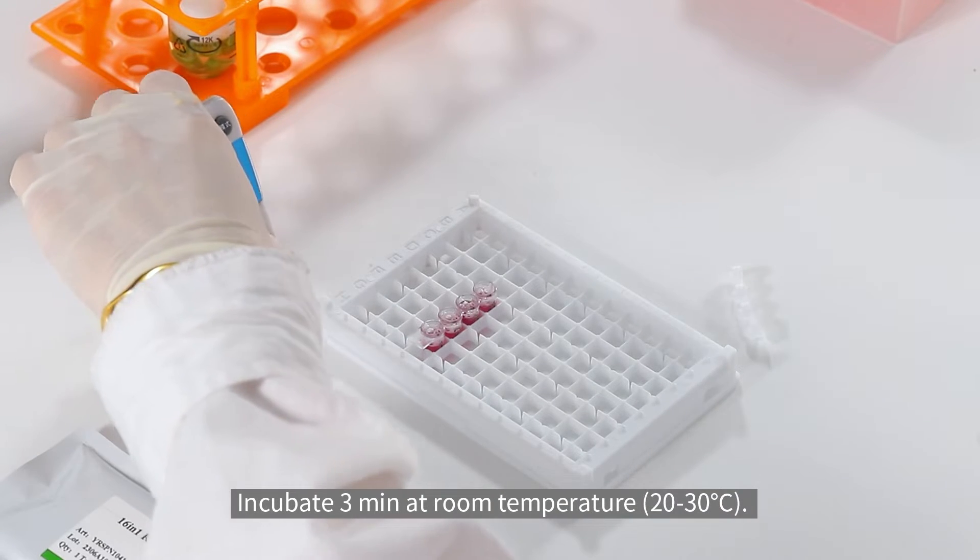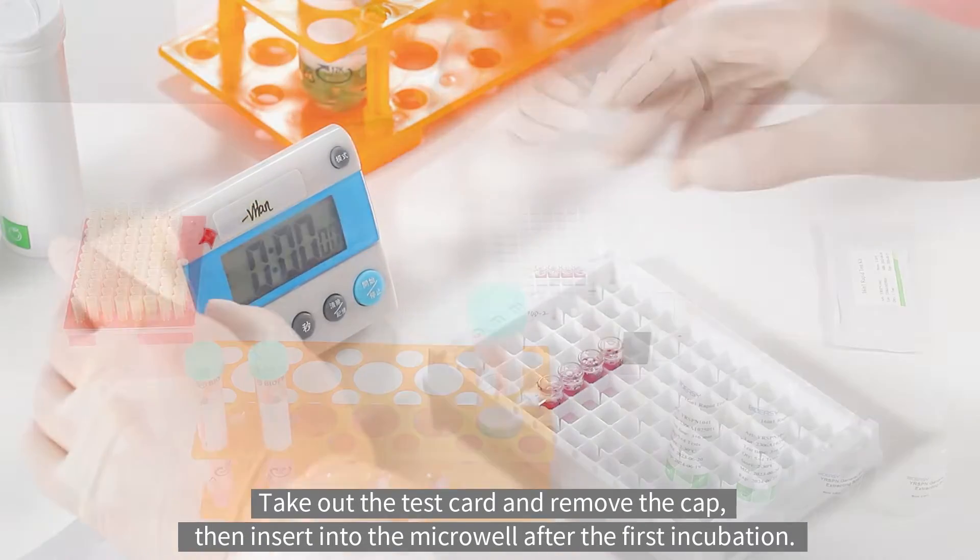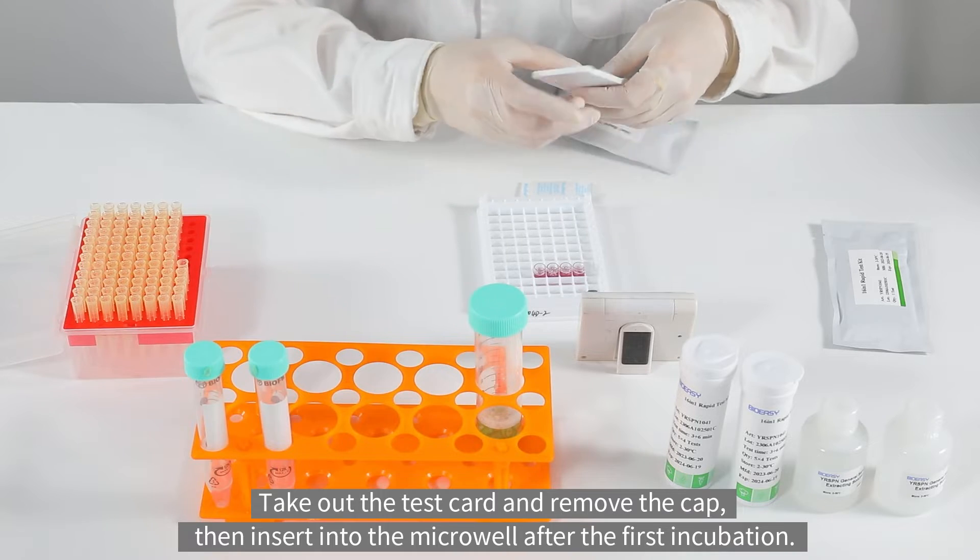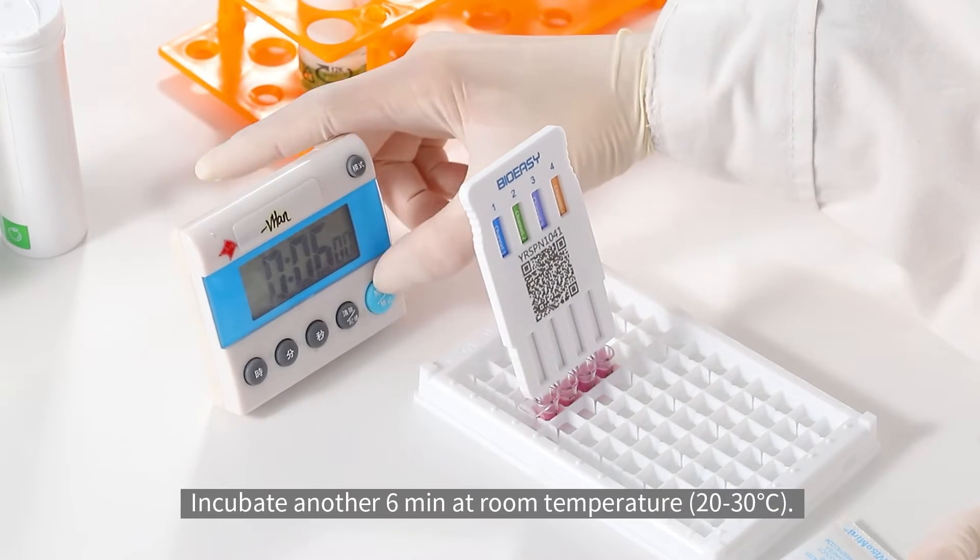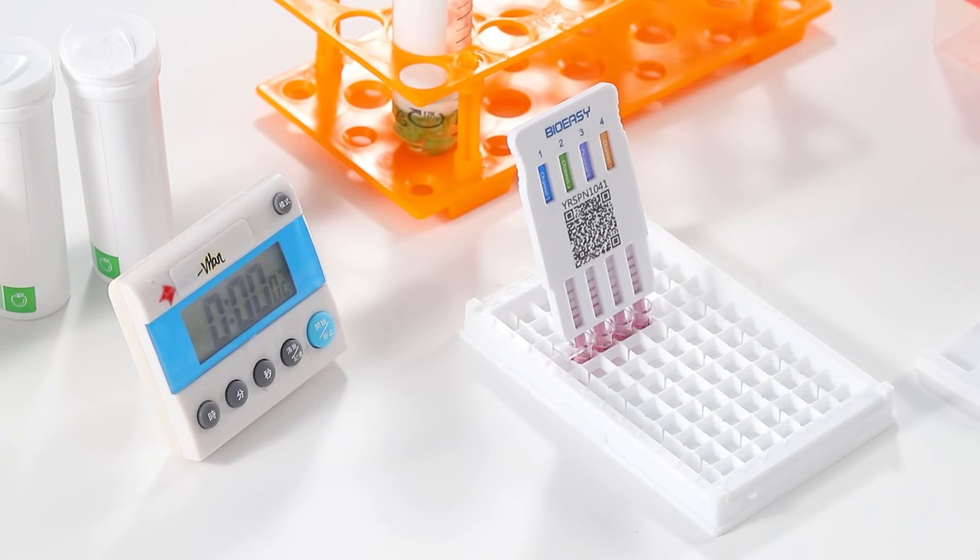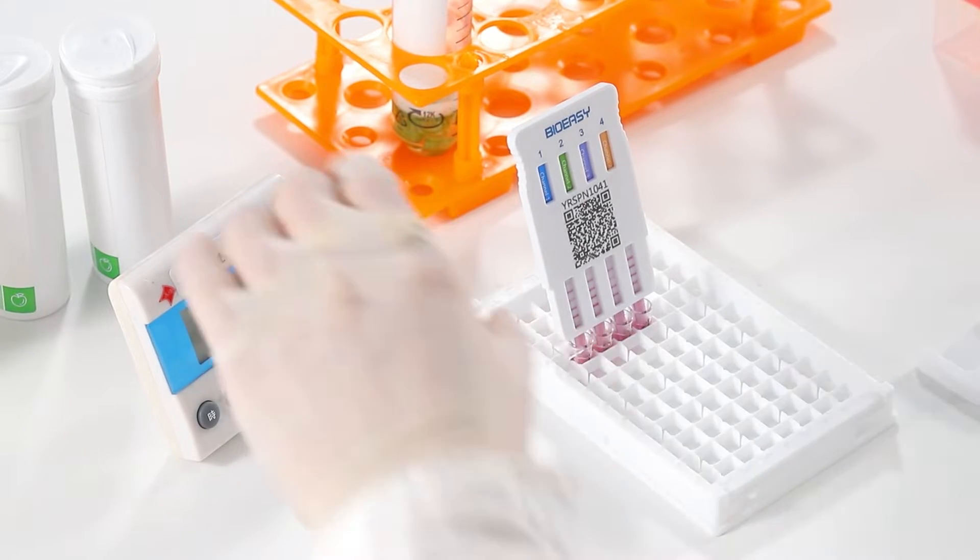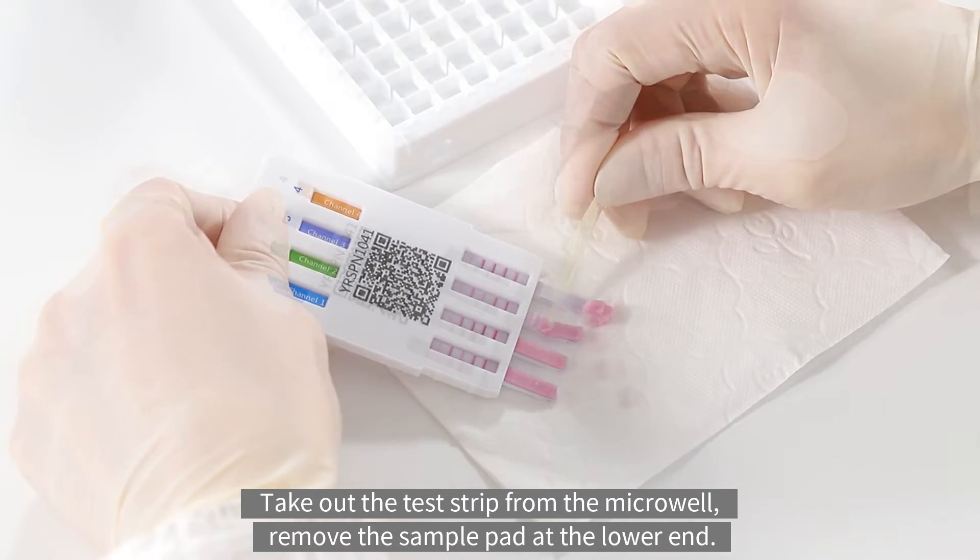Incubate 3 minutes at room temperature. Take out the test card and remove the cap, then insert into the microwell after the first incubation. Incubate another 6 minutes at room temperature. Take out the test strip from the microwell, remove the sample pad at the lower end.